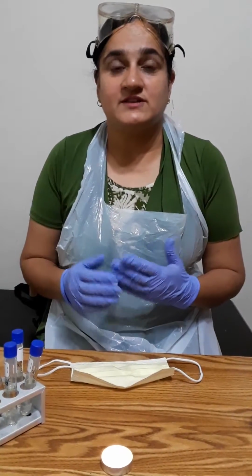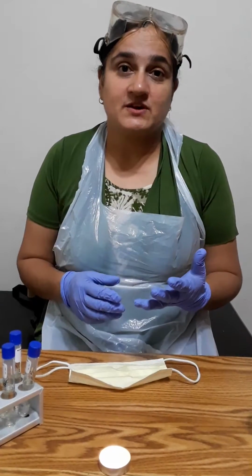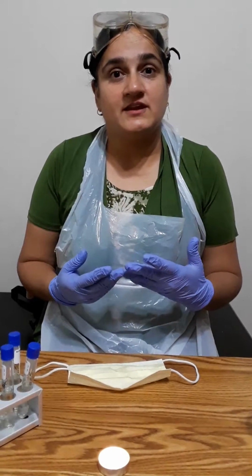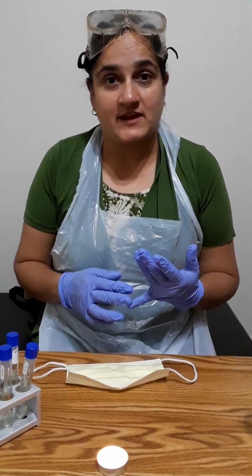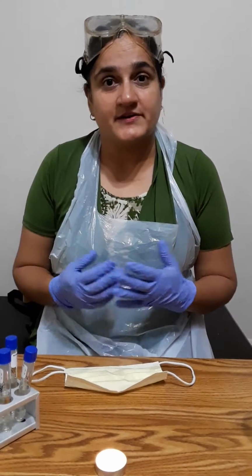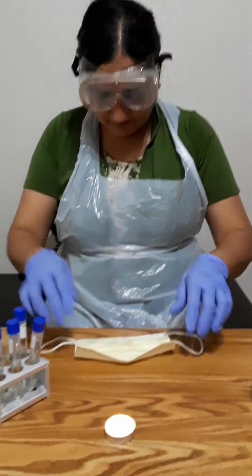In this experiment I'm going to observe the two microbes, S. epidermidis and S. cerevisiae, for pH, that is, whether they grow more in an alkaline environment, or in a more acidic one, or whether they like the neutral environment. So I'm going to start my experiment now.